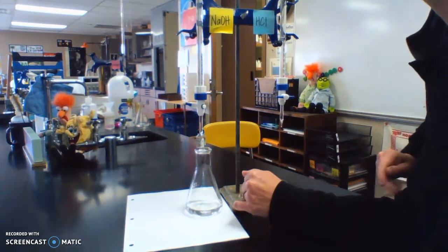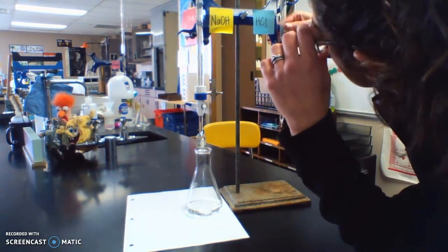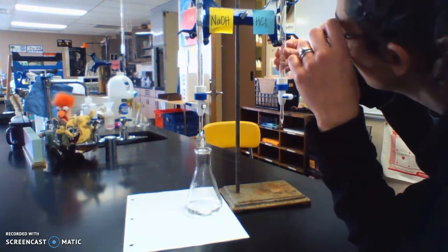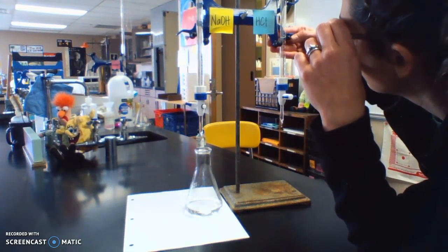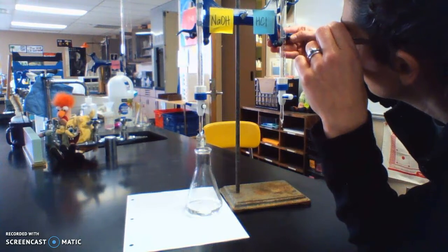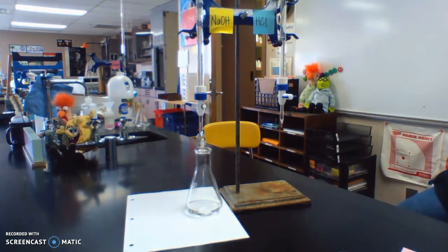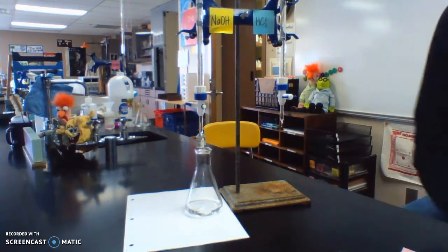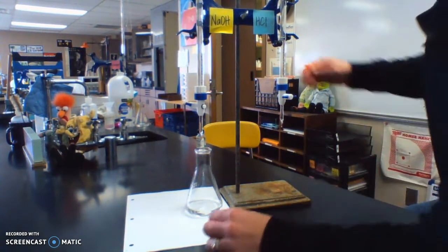Okay, so our end volume for our acid is 43.09, sorry. 43.09.